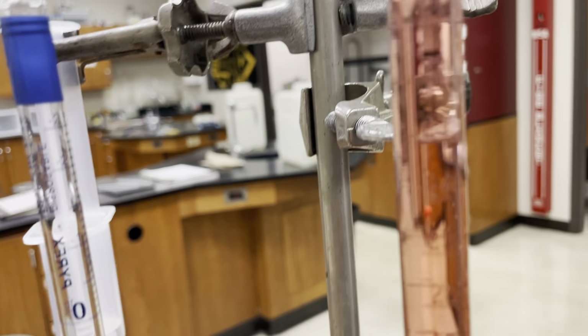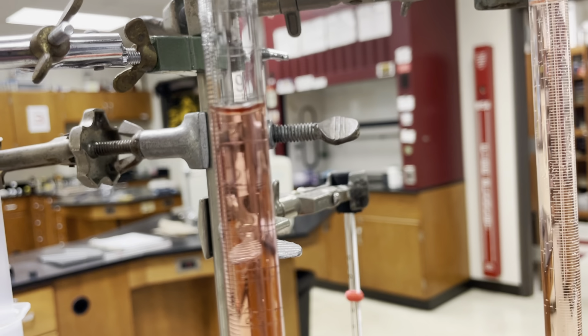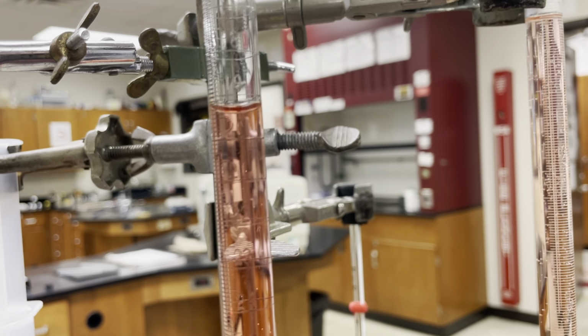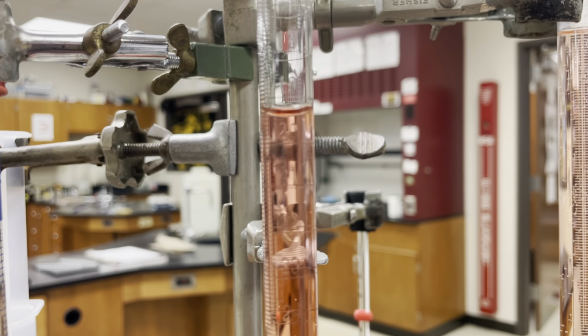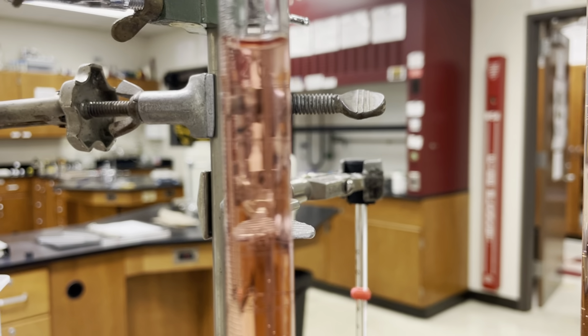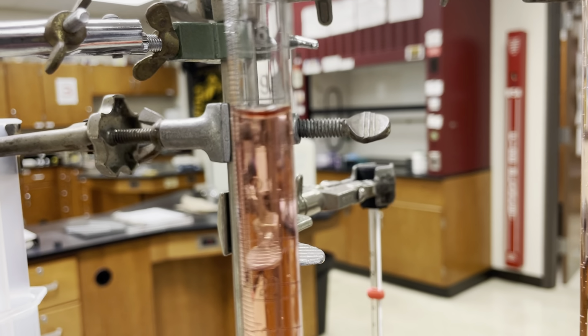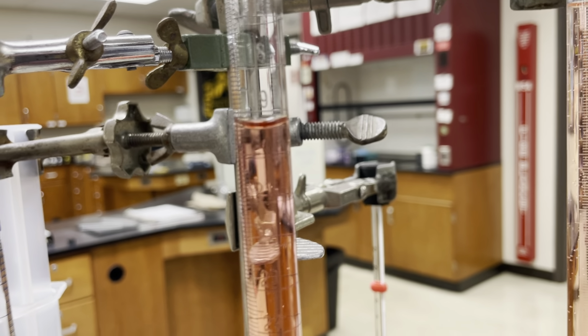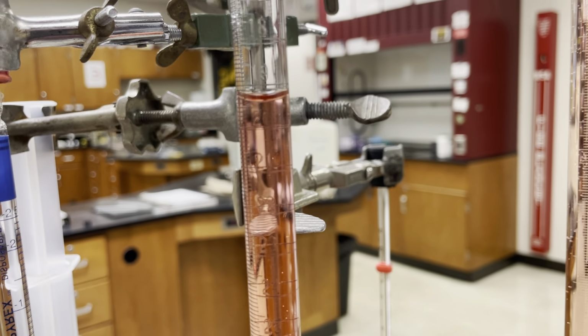Looks like about 19.4. Okay, now again, since each of these lines is a tenths place, we can actually go out to the hundredths place. So we could say 19.40 is our volume here. And you want to include that uncertain digit whether it actually strays out into the hundredths or not. So if you land right on like 0.4 or 0.5, that's okay. Just make sure you include the 0 after it to show that you could know out to that farthest uncertain digit in the hundredths place.